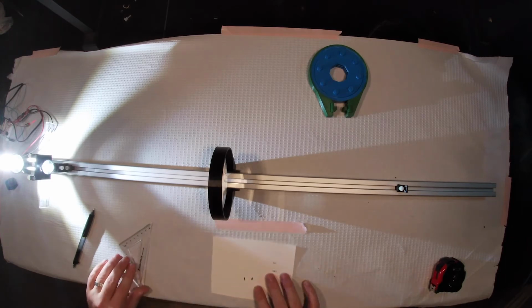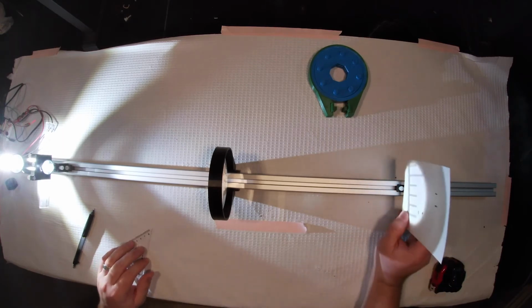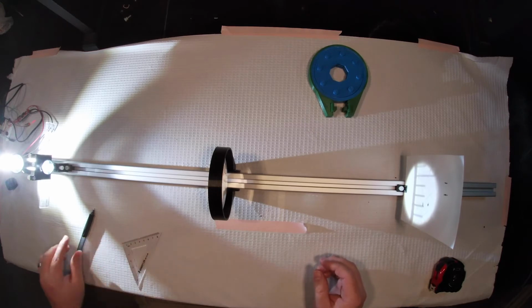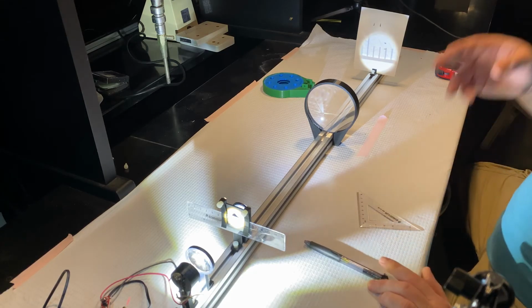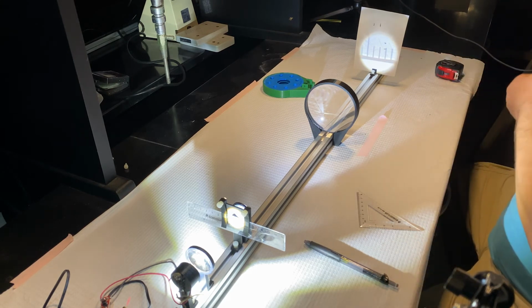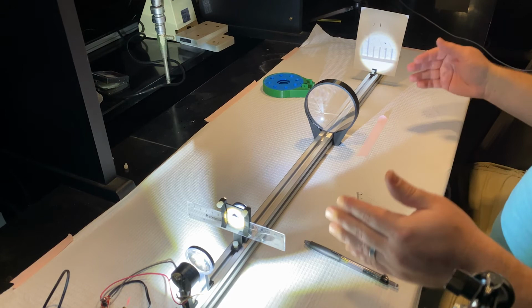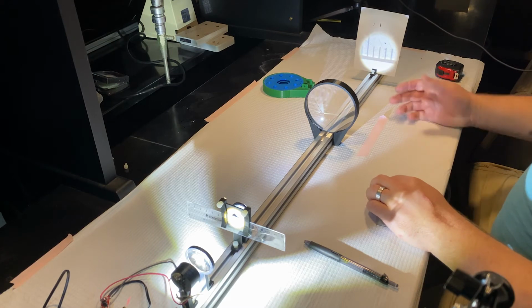So to my eye that looks about 15 millimeters. So using the formula to calculate magnification, we know that 1 millimeter in our object space is 15 millimeters in our image space. You should be able to calculate that our microscope has a magnification of 15x, 15 times. Now, that is the empirical way to calculate it.